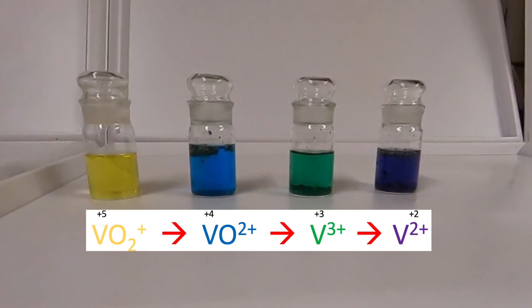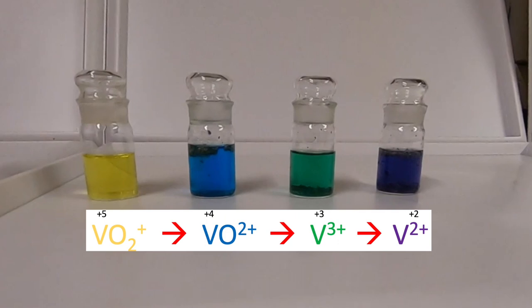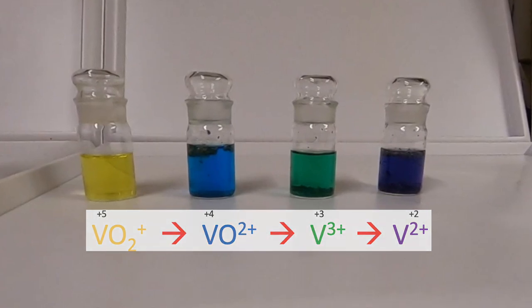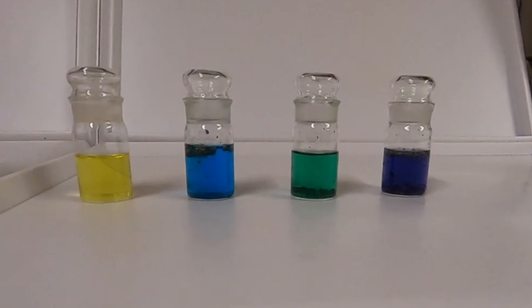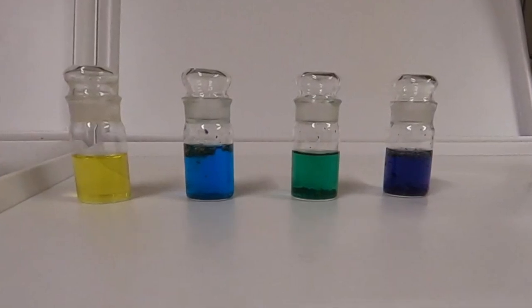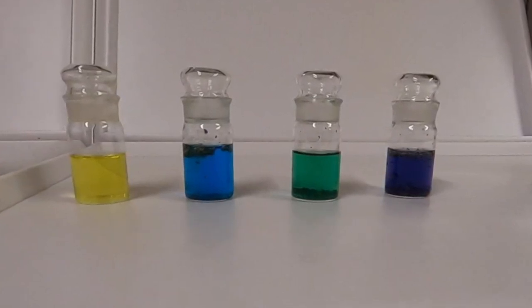The zinc in acid solution has been used to reduce vanadium through these different oxidation states.